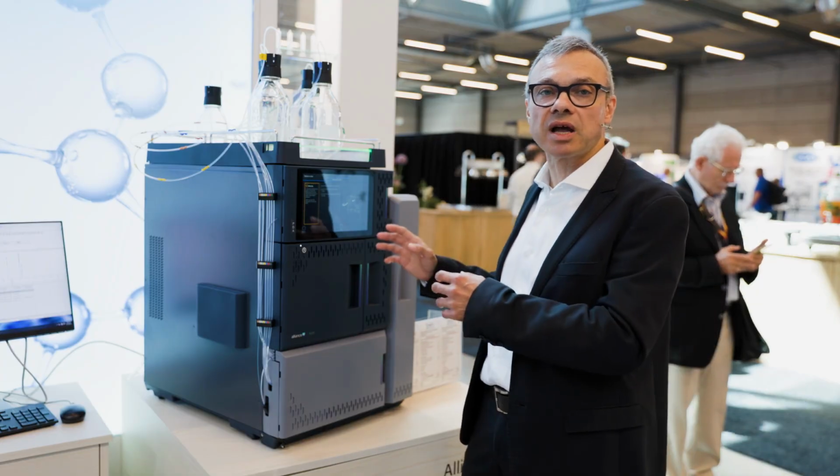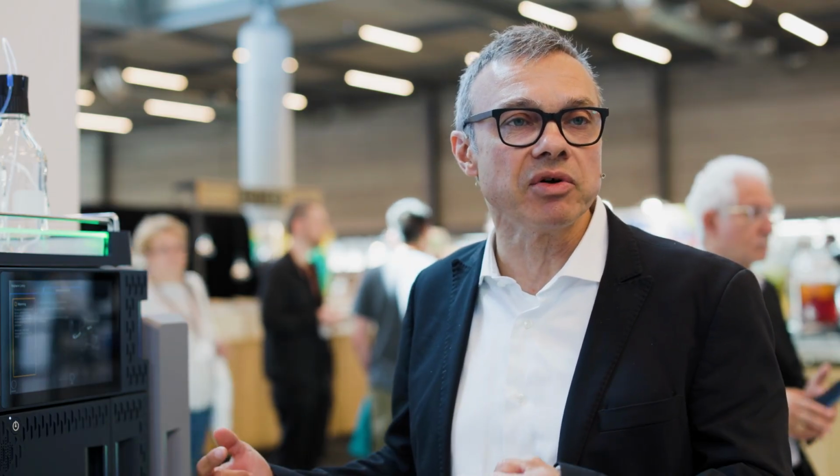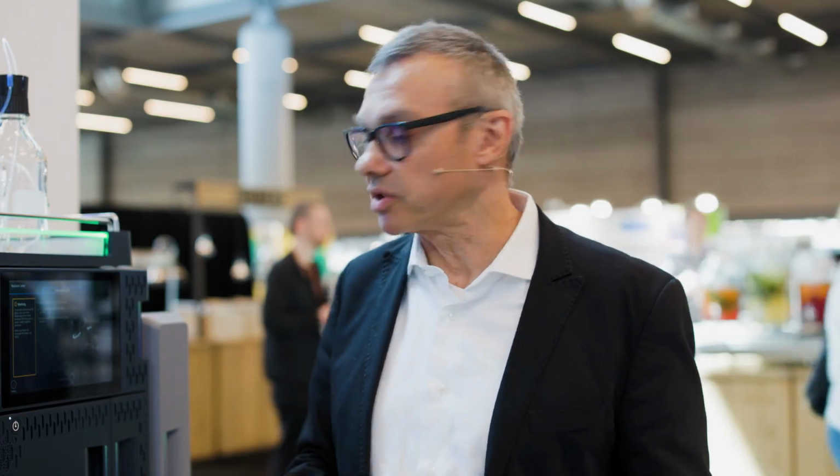So I wouldn't waste time going into the lab, searching for the instruction manual, or asking my colleagues how to do that, because the system would tell me what to do and how on the spot. So there would be no wasted time in needless operations.